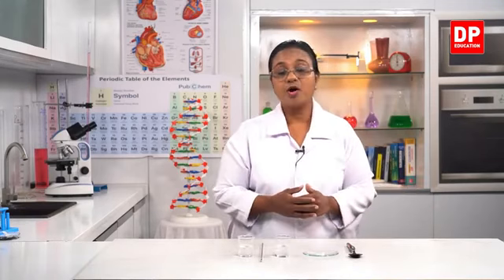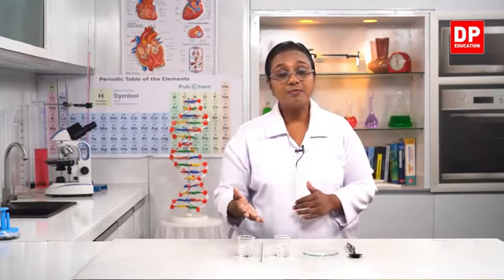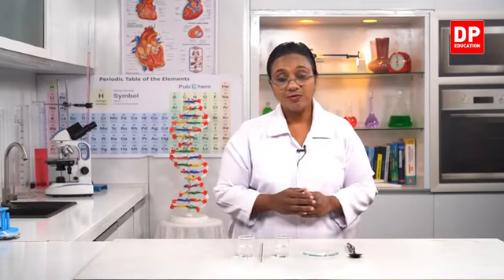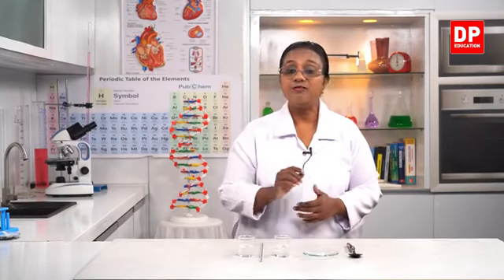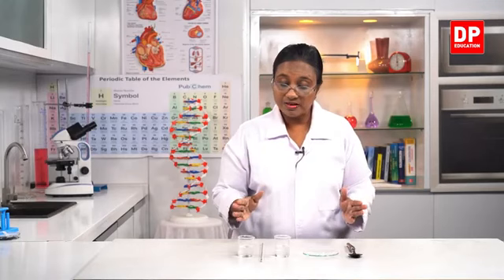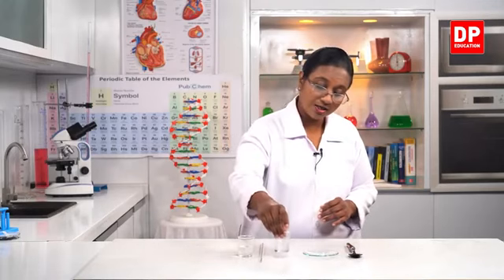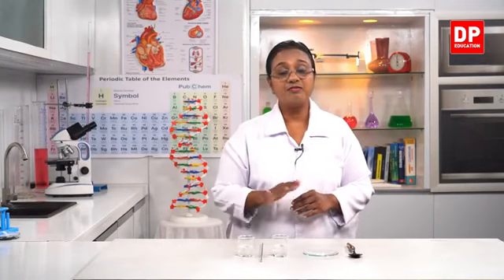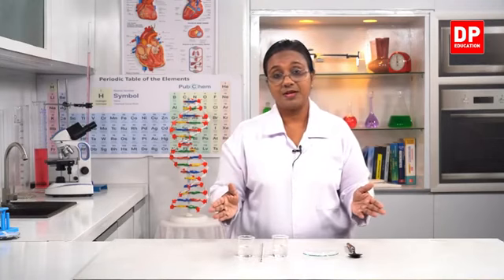Now, magnesium oxide is the final substance. Then, in the third activity, sodium hydroxide pellets, you were able to see the solid pellets. This was the dilute sulfuric acid solution. Into that, when I put the sodium hydroxide pellets, you saw the pellets dissolving completely. Now, this is what we got, a clear solution. At the same time, you observe the increase in temperature.